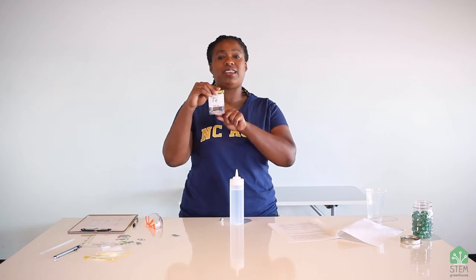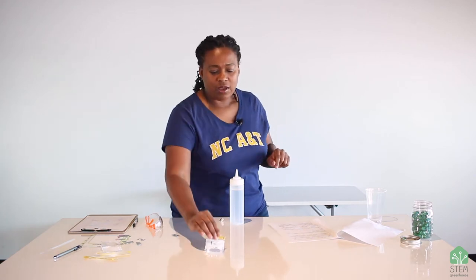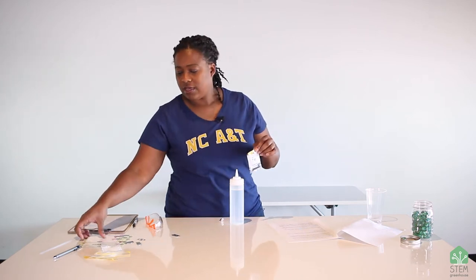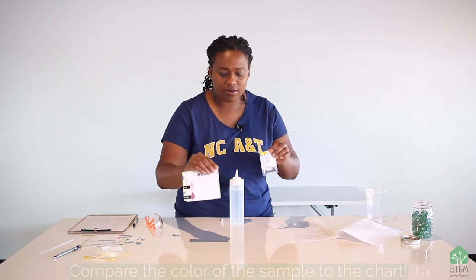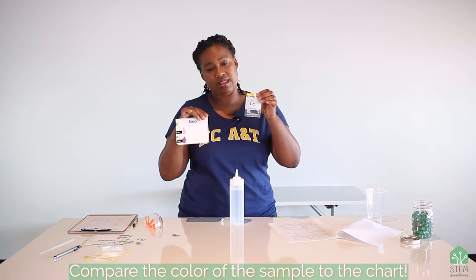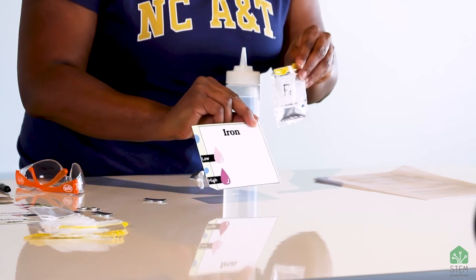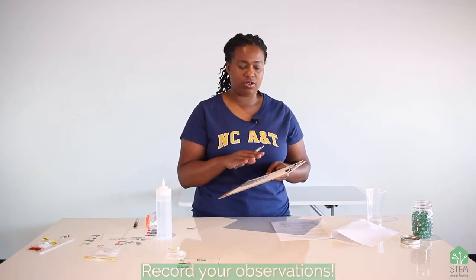Now the iron indicator tablet has dissolved in the bag. If you look at it, it didn't change color very much, and I don't want you to be discouraged if that happens — all that means is there's probably not a lot of iron in your water. So you take the color chart and compare the color on the chart to the color in the bag. This one didn't change much at all, so the iron level is very low, and that's fine. You don't need a lot of iron in your water. After you see the results, write down your observations on your observation chart — I would say the color is clear or perhaps a light purple.